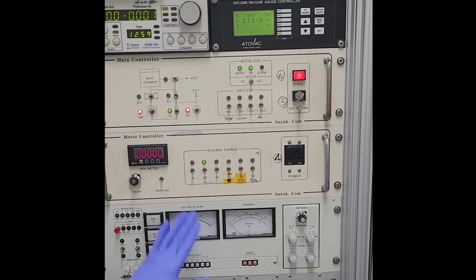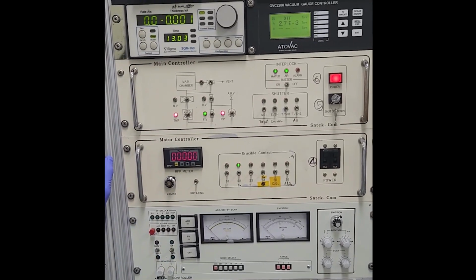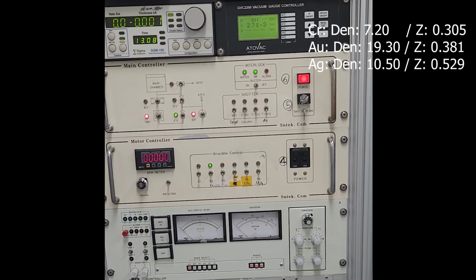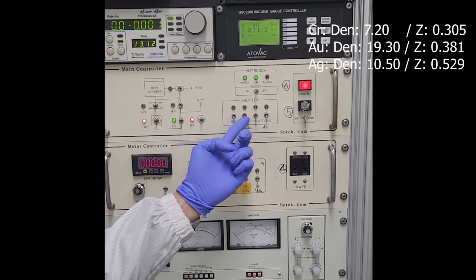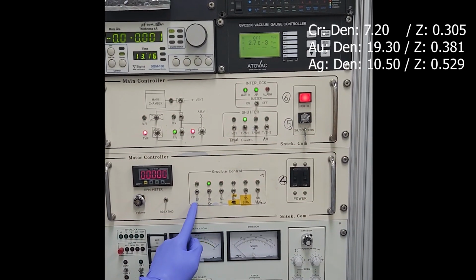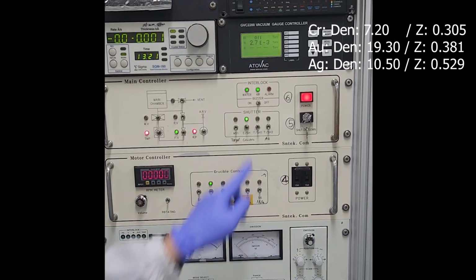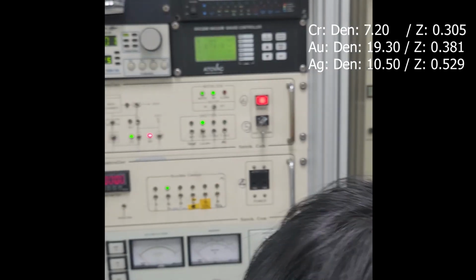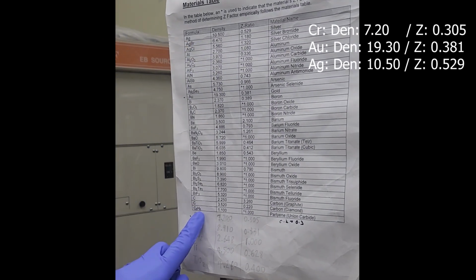And now we start the E-beam. The first thing we need to do is open the crucible. The crucible can hold chrome or nickel or titanium or something, but we should open it first. You want to deposit chrome, right? We want to deposit chrome, so we have chrome.